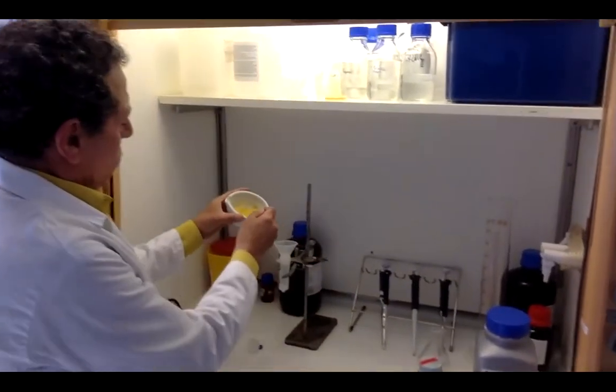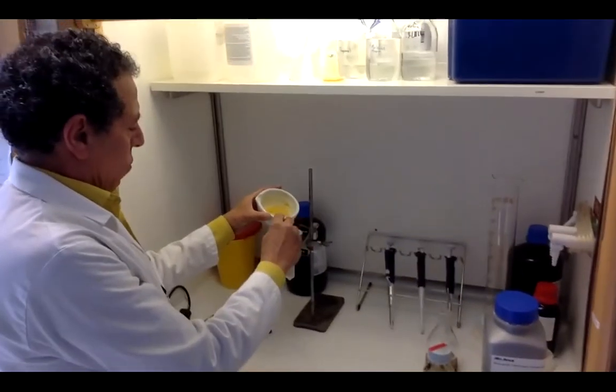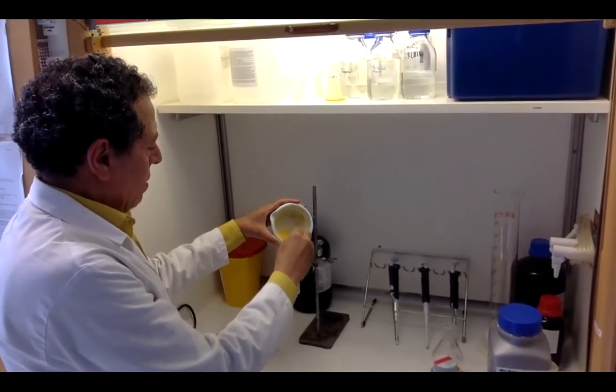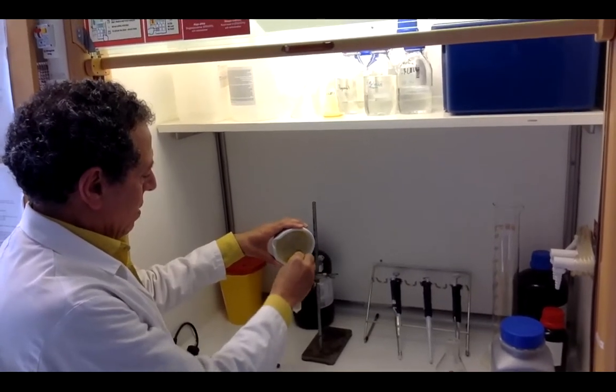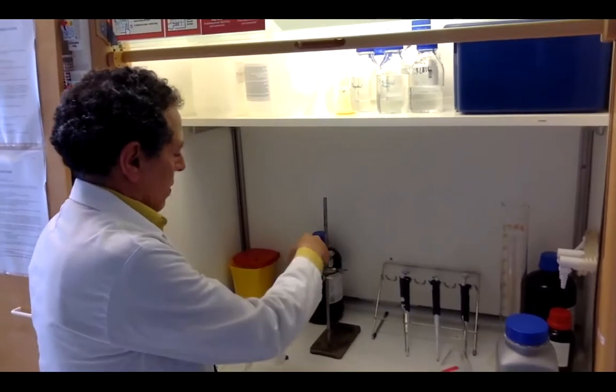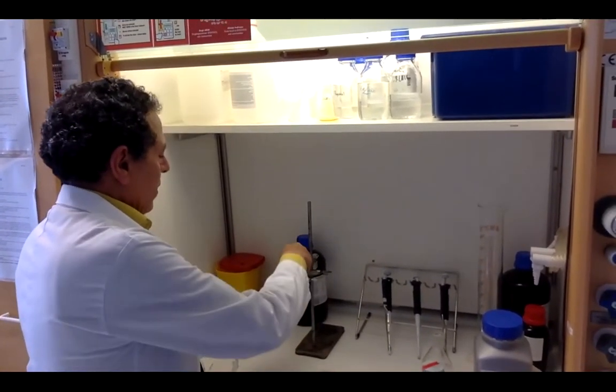Then you make a dry packing to the column. After dry packing, done.